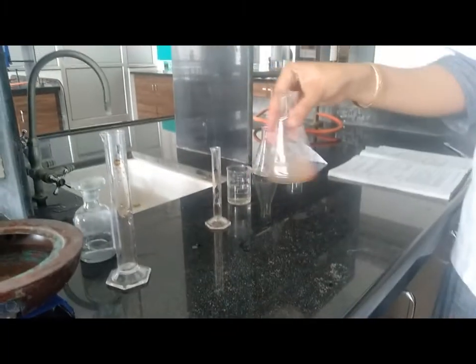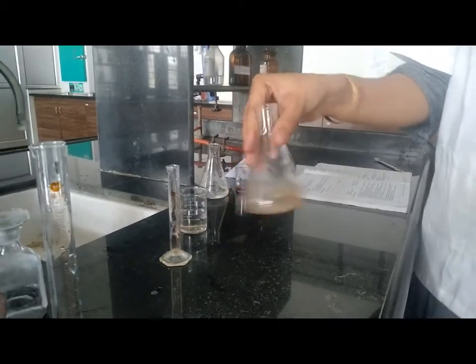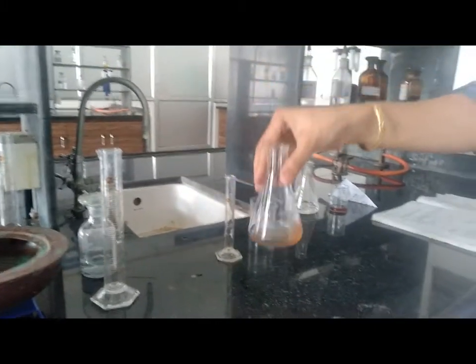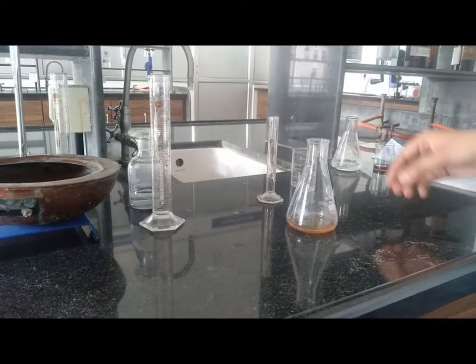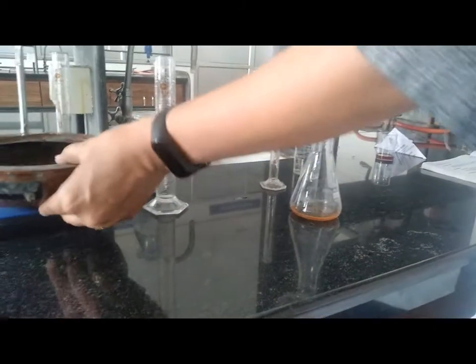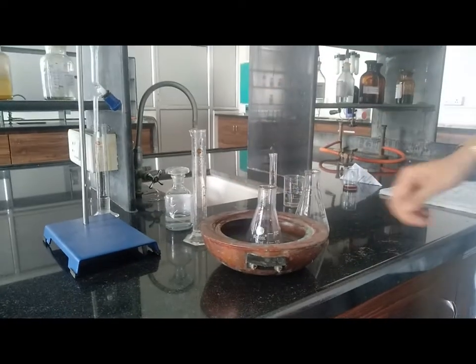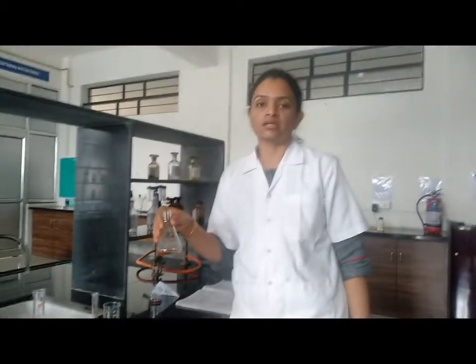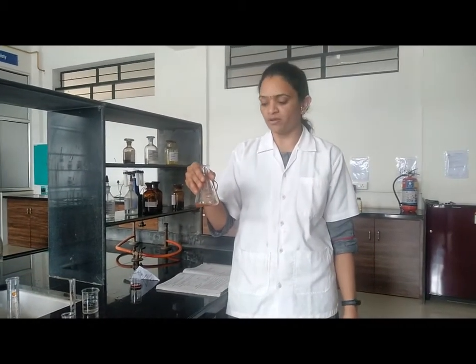Take it properly. This solution contains 12.5 ml of glacial acetic acid and 2.65 ml of bromine. Then place this solution into cold water. Fill the burette with this bromine solution — the burette contains 12.5 ml of glacial acetic acid and 2.65 ml of bromine.